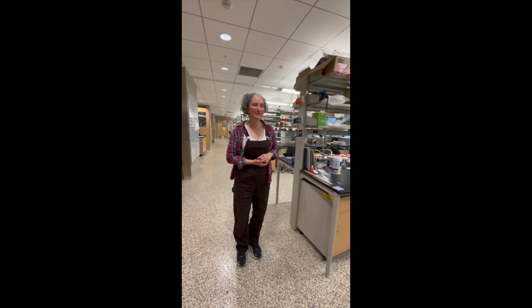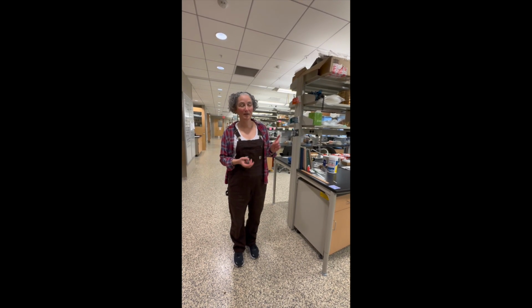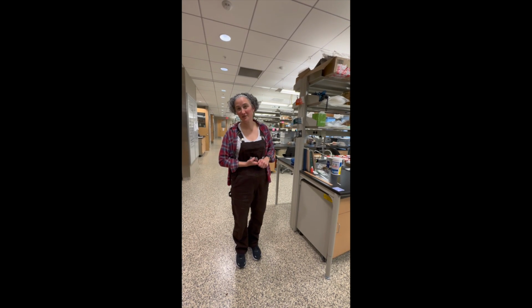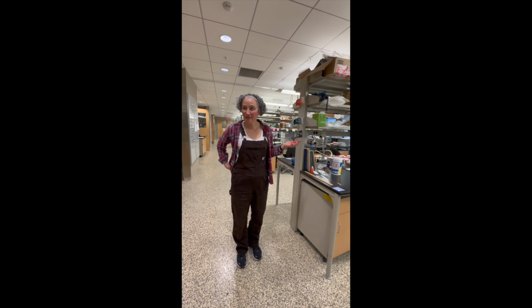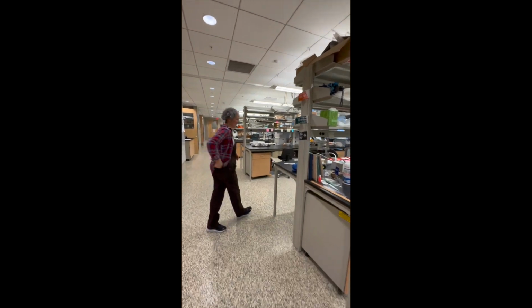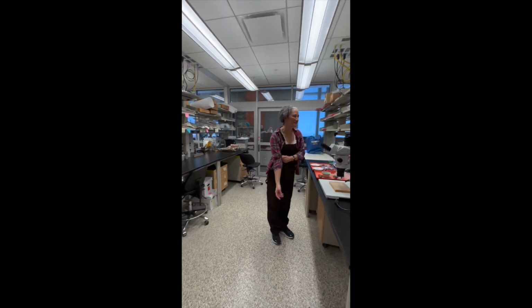We have samples in the lab at the moment from Virginia, from Dr. Heath's work there, but also from Alabama, Mississippi. We've just got a set of samples from North Carolina, and they range through time from around 6,000 years ago up through about 200 years ago. So a wide range of places and a wide range of time. We are looking primarily at flotation samples.